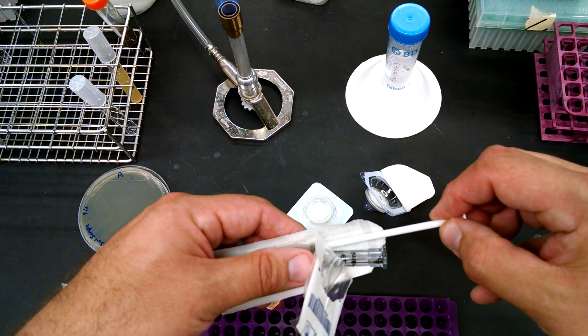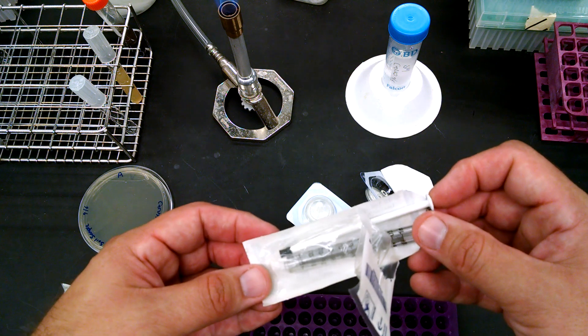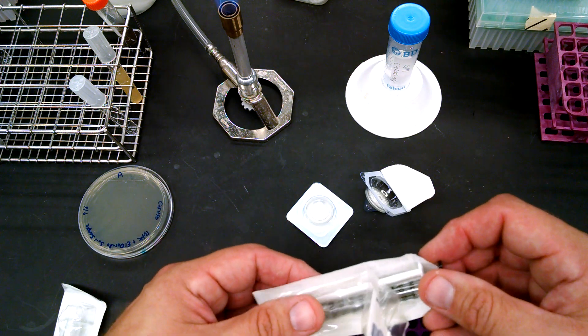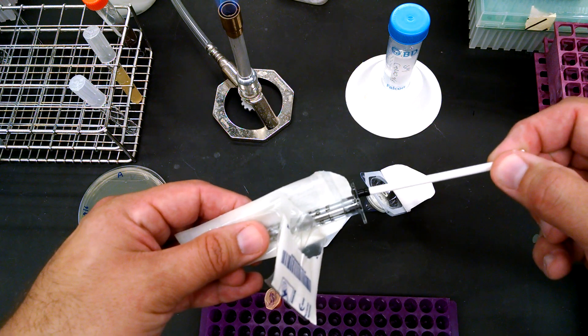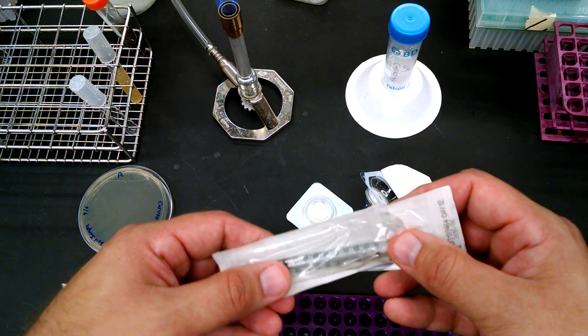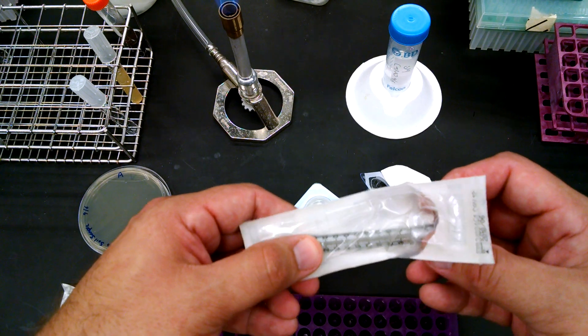You can always put it in the paper if you don't want to touch it, okay? All right, but for now I'm going to show you one way that we can load these syringes. There's going to be two ways that we can do it and I'll also demonstrate how well they work.